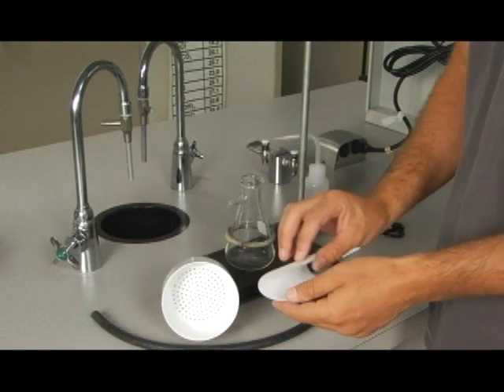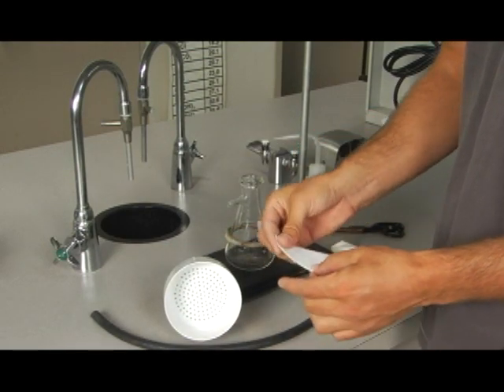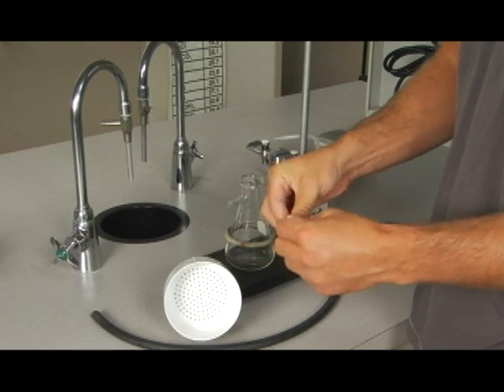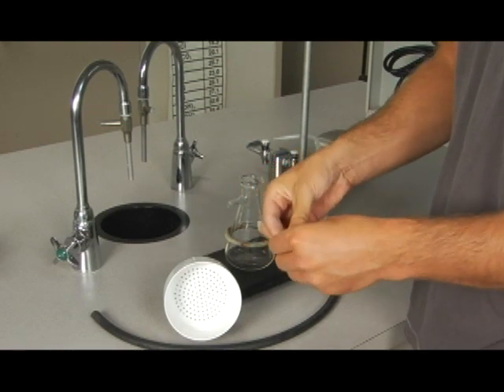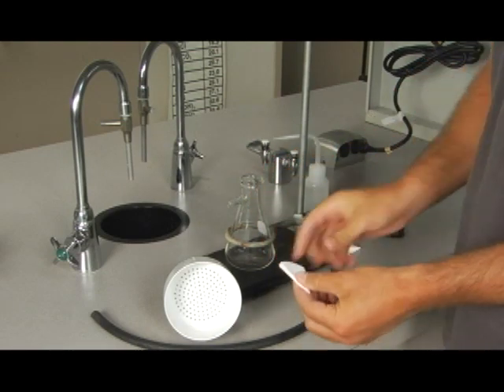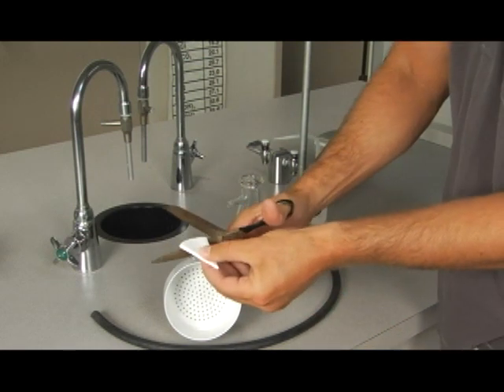The best thing for you to do is fold the filter paper in half, then into quarters, and into an eighth. That way your cut is very simple. You cut right along the edge.